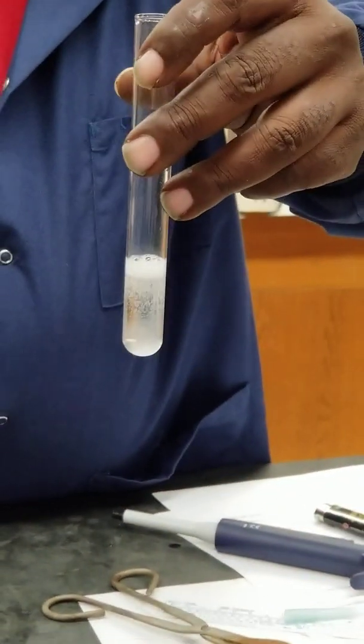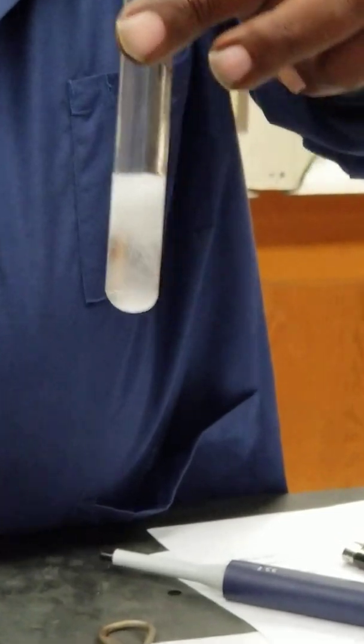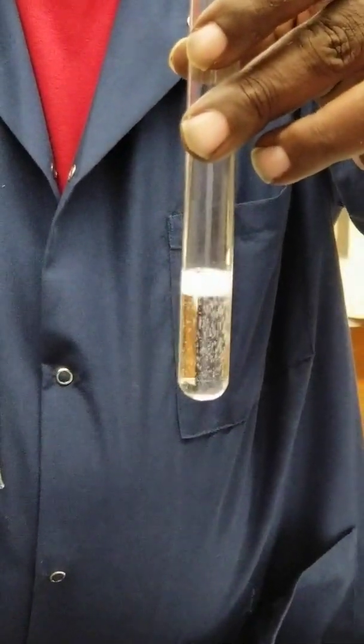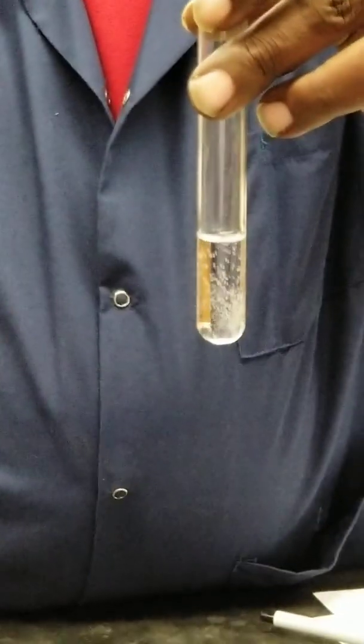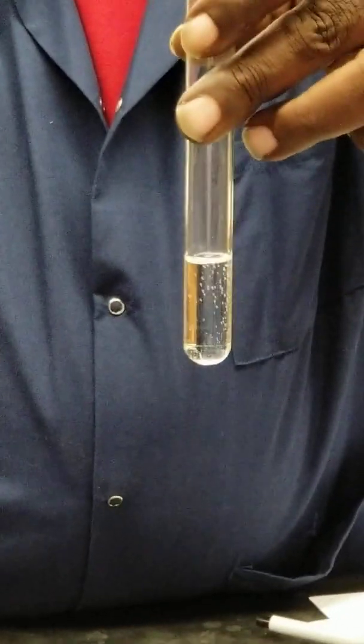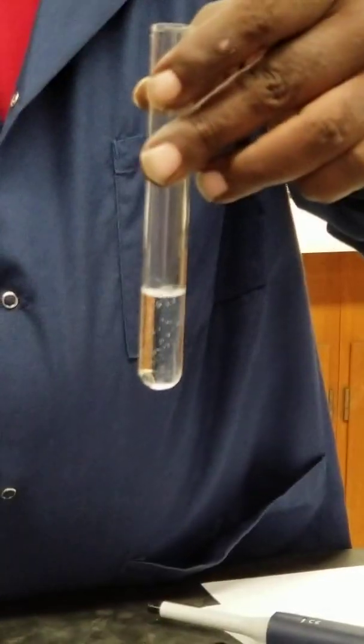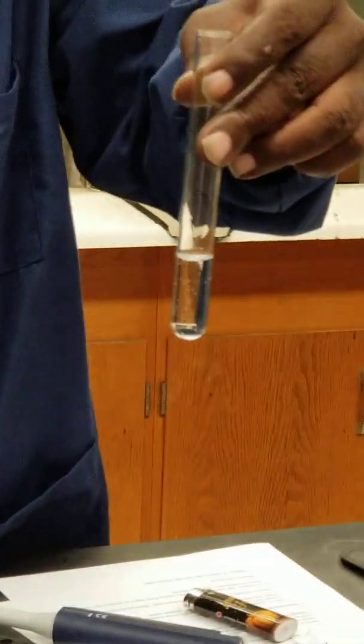I'm going to make sure my hand is not messing up the view here. You can then record your observations with respect to this reaction.